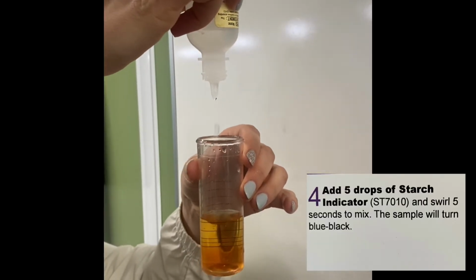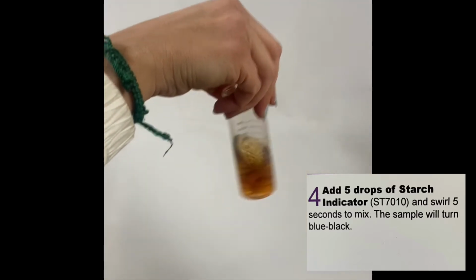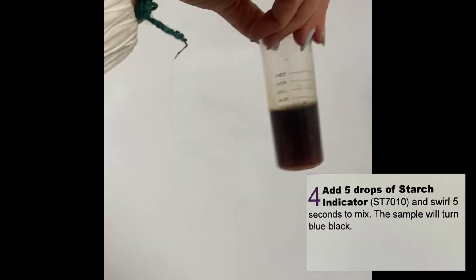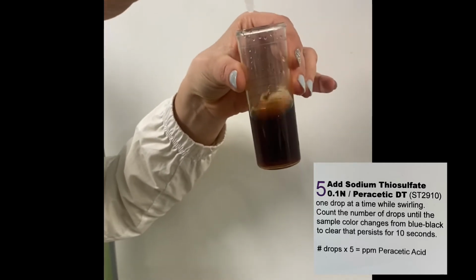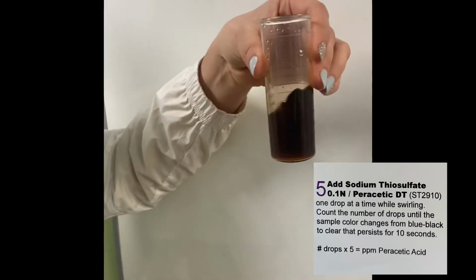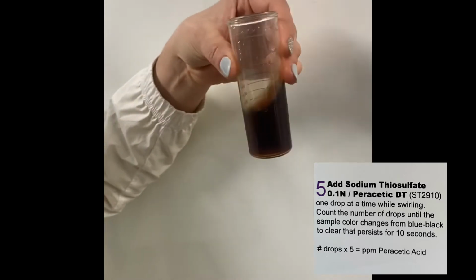Step 4, add 5 drops of starch indicator and swirl for 5 seconds. The sample will turn a blue-black. Step 5, this is when you're going to get your results. So you're going to add sodium thiosulfate 1 drop at a time while swirling. Count the number of drops until the sample changes from blue-black to clear.